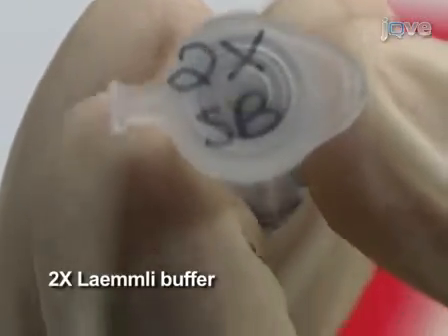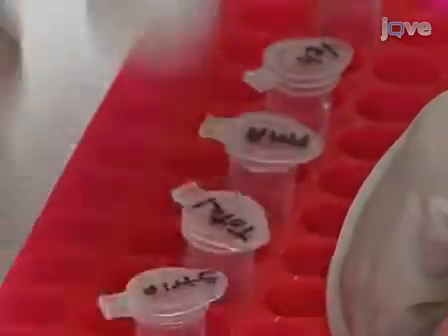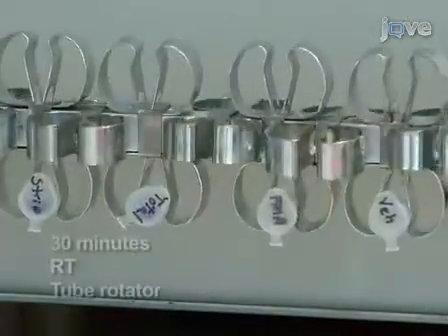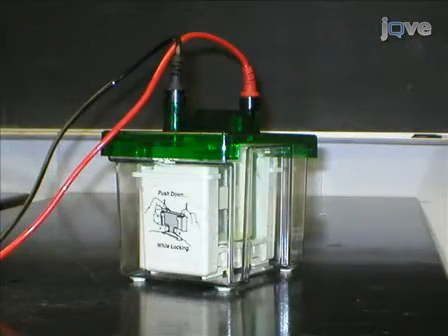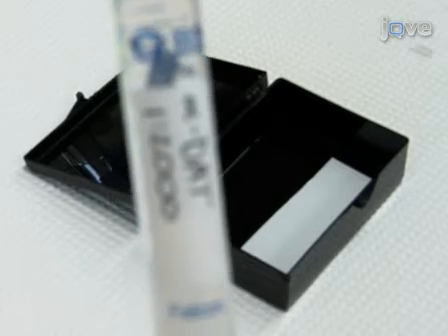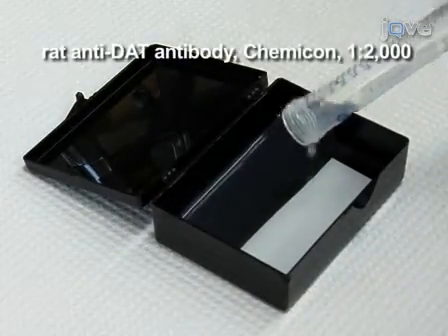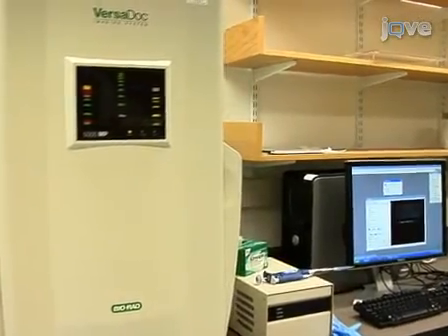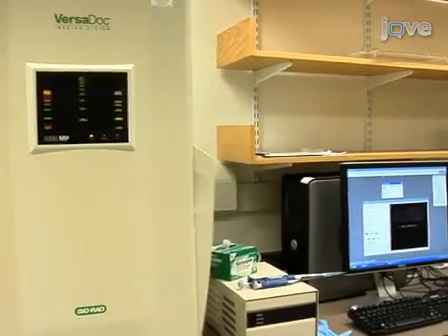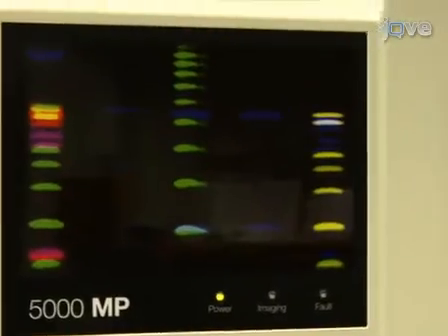Next, add 20 to 25 microliters of 2x reducing Laemmli buffer to each tube. The reducing agent will cleave the NHS-SS biotin disulfide bond, releasing the isolated proteins into solution. As most membrane proteins cannot tolerate boiling, incubate tubes on a rotator for 30 minutes at room temperature. Following reduction and denaturation, separate proteins using a standard SDS-PAGE gel, transfer proteins to a membrane for immunoblotting, and blot with an appropriate antibody. In this experiment, we use a rat anti-DAT antibody from Chemicon No. 369 at a 1:2000 dilution. Capture immunoreactive bands using a CCD camera gel documentation system, ensuring there are no saturated pixels. We use a Bio-Rad Versadoc imaging system with Quantity-1 software to quantify each band density.